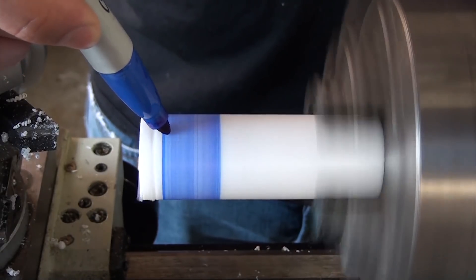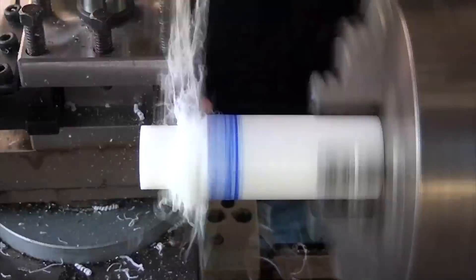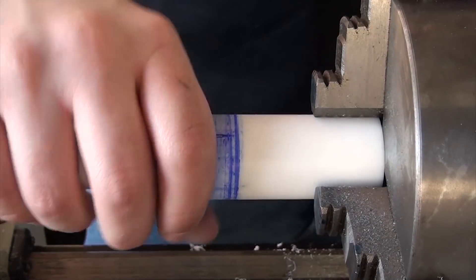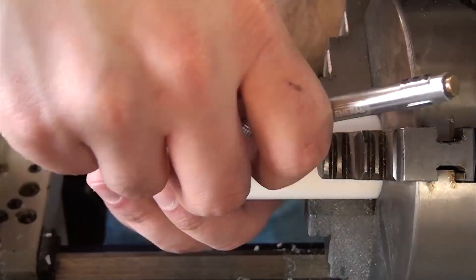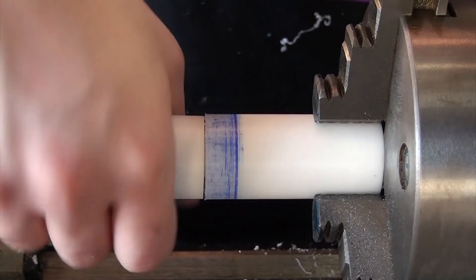Next onto the other half — same basic idea, but this time I started with the rotary end. I marked out one inch, and then reduced the diameter until it fit snugly but could still rotate in the other half I'd just made. After choosing a spot for the o-ring, I used my parting off tool to cut a groove to fit it. The depth of this groove was gradually increased until the two halves could fit together with a bit of effort.